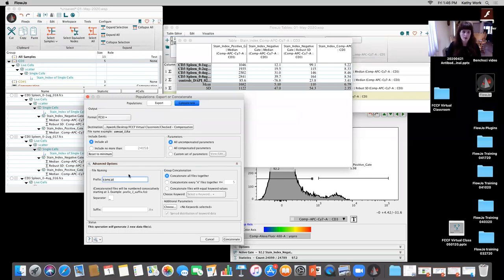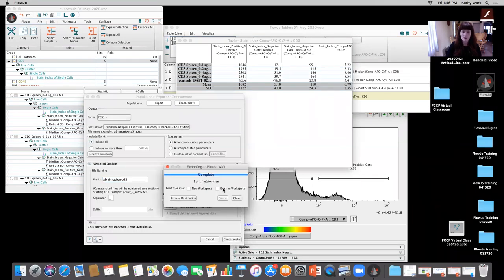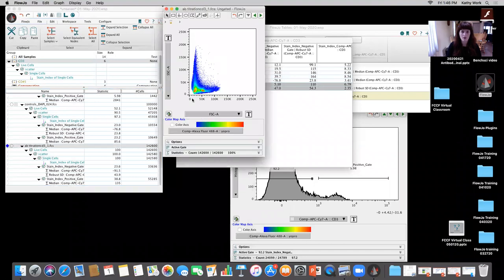So I'd hit concatenate there, and you can change the name here. You can also, in the destination right up here, change where you want it to go. So I'm gonna have it go in where it's supposed to be in the antibody titration. I'm gonna have it say antibody titration, CD3. I'm gonna concatenate it and put it in the existing workspace. Okay, it's complete. I can close it up, and when I do that, what I'll see if I click right there, it already has all the gating from the previous samples.